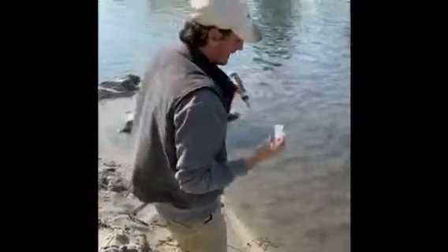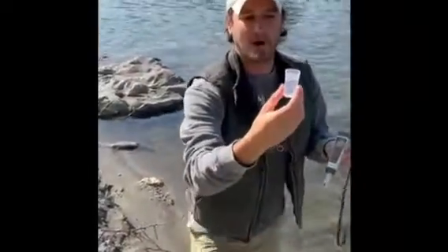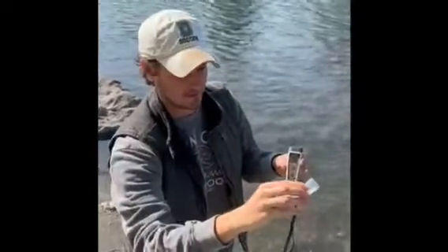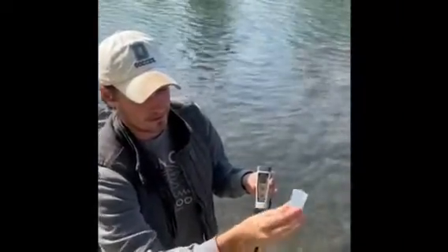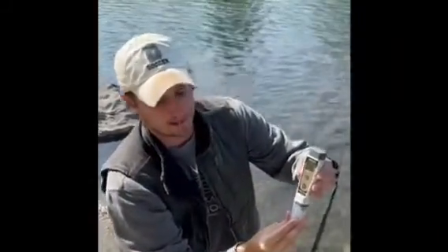So at your site you're going to enter the water and fill the cap up. You can pour off the water to get to the black fill line. Here we're right about at the fill line, and so you're going to put the pen in like this.